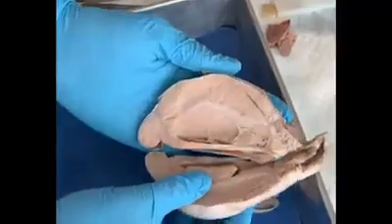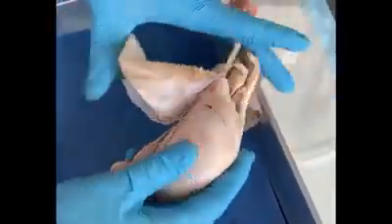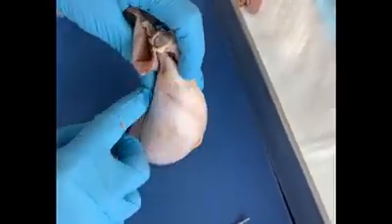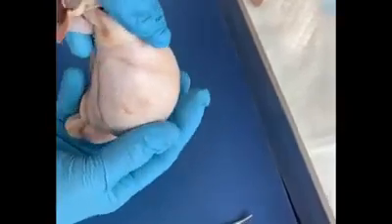place. Now if you look at the structure of the testes after removing the tunica vaginalis, you will notice that there is a C-shaped structure. See the C-shaped structure? This is the epididymis, and this is found in the posterior part of the testes. So this is the anterior side, this is the posterior side.